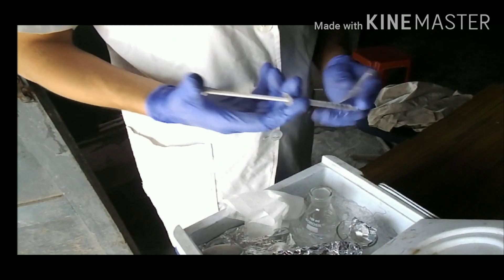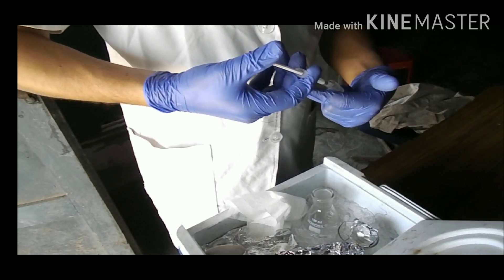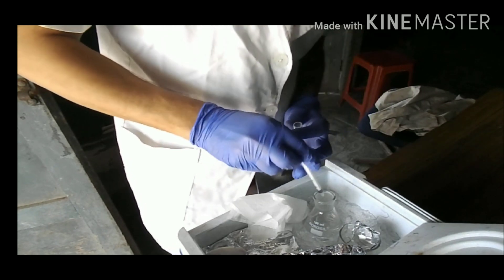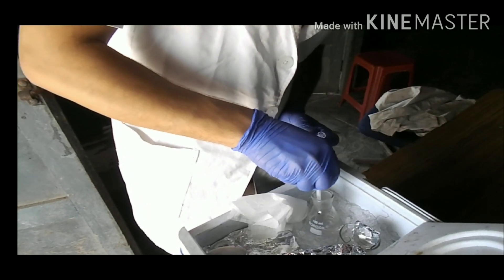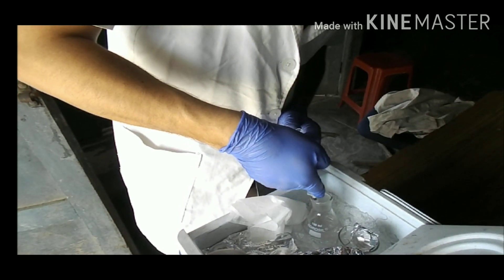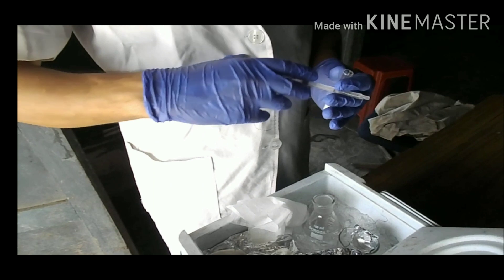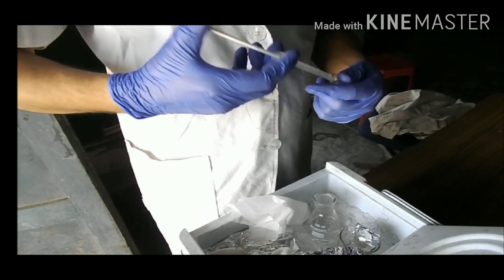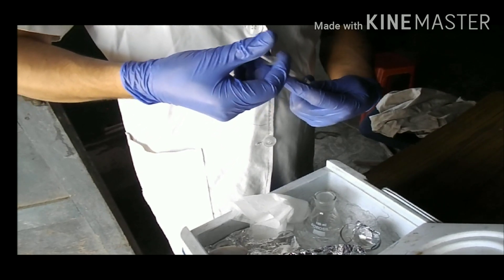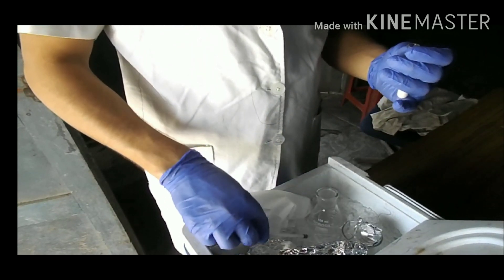This is 1 ml of diluent; I will add another 1 ml to make it a 1:2 dilution, which generally gives the best fertility results. Instead of diluent you can also use normal saline for diluting poultry semen. Importantly, artificial insemination in hens must be performed within 30 minutes after collection, because we cannot store poultry semen.